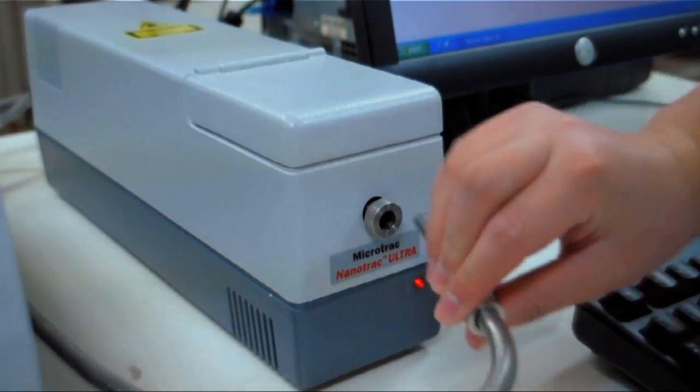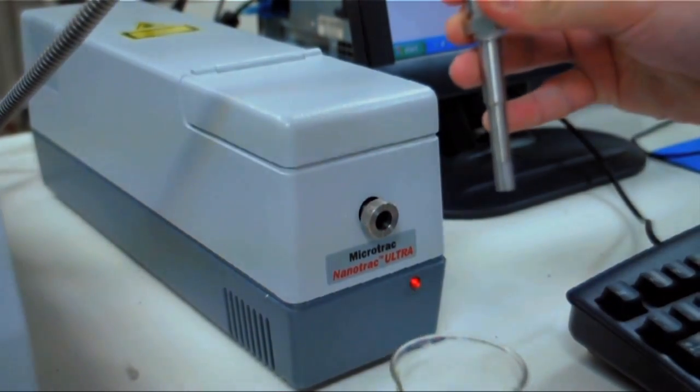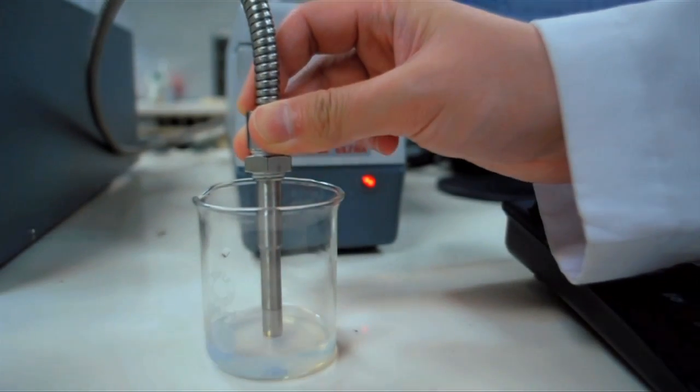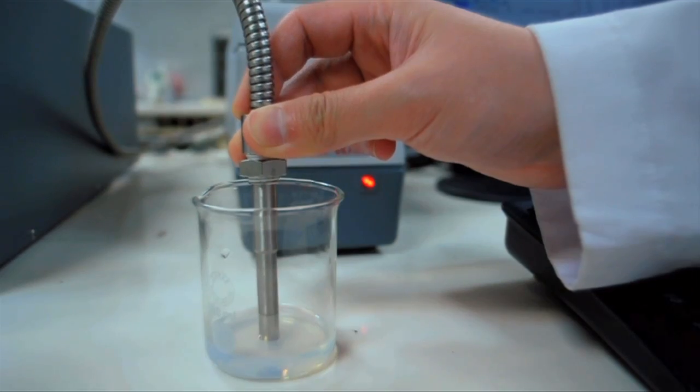This is how the probe is used for the analysis. Simply dip the probe into the sample and click run on the software.